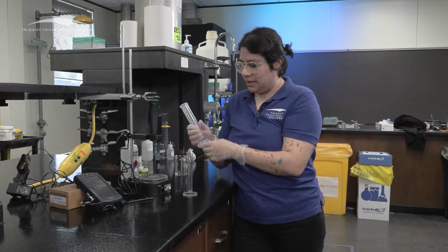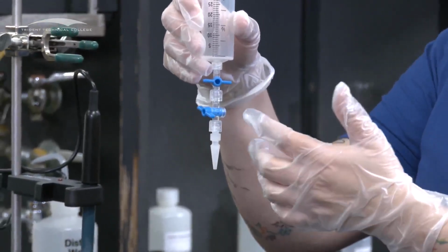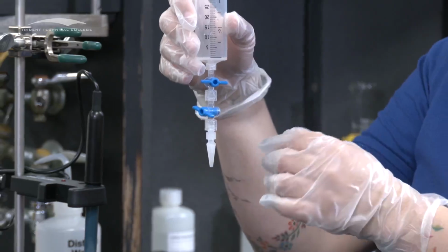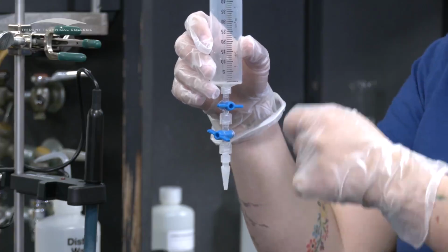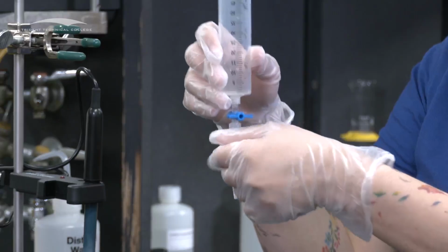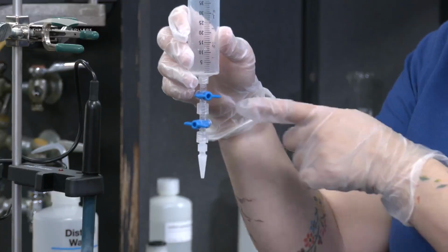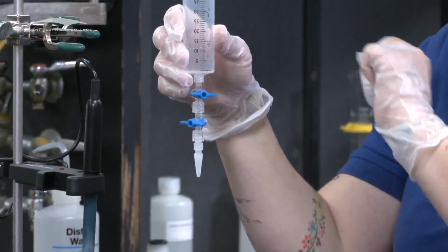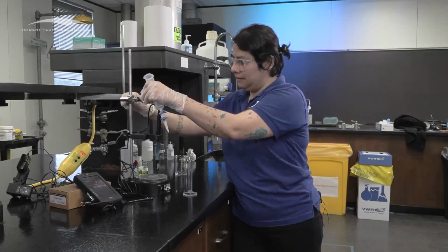So to calibrate this one, if you notice, this has 2 stopcocks. Normally we use 1 stopcock. So the whole idea is that when you're calibrating, you're going to set your flow rate, which is the speed of the drops, with one of them. I like to do usually the bottom as my flow rate, so I don't touch it ever again. And then the top is going to be my open and close. So I'm going to put it in here.